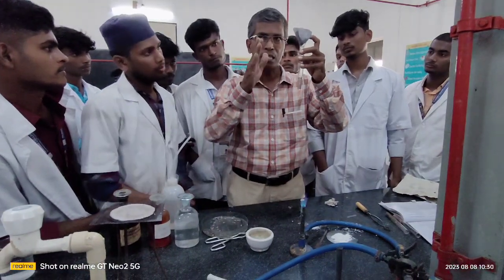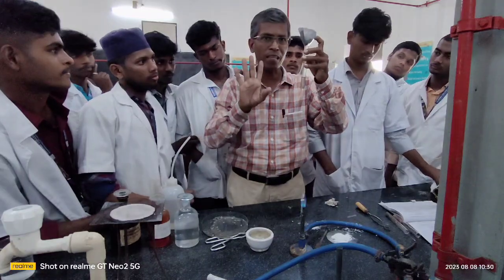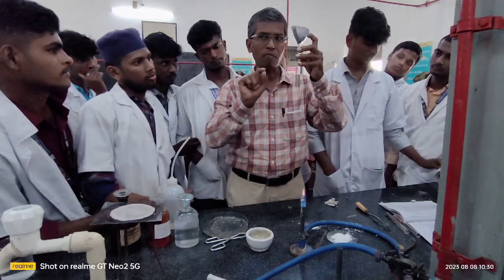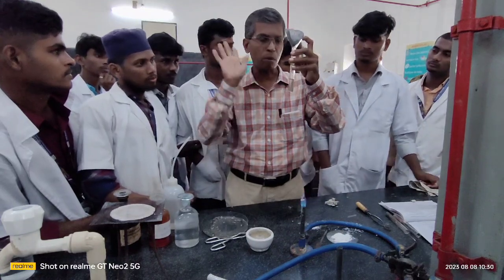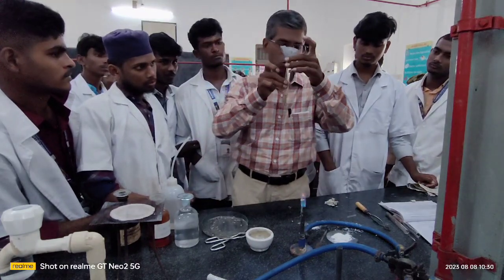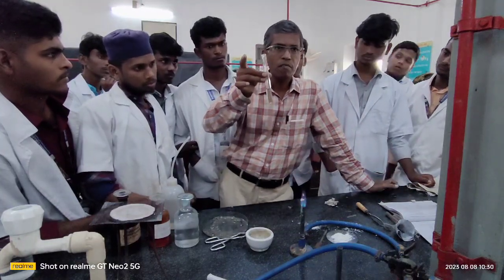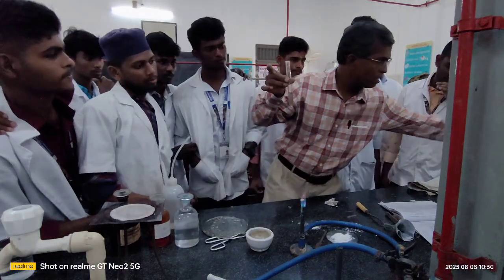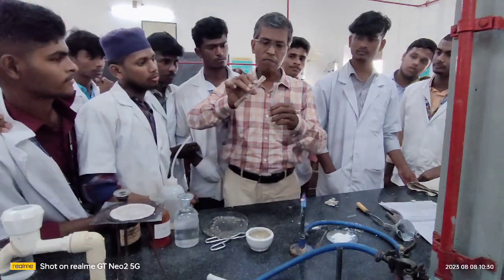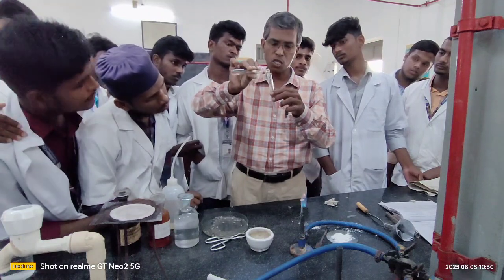I told you that the halogens and the sulfur part of the elements we are usually not providing. Therefore, your focus should be whether nitrogen is there in the organic compound or not. Now the filtration is over, and this extract is called sodium fusion extract. Very simple. Take a little amount of the sodium fusion extract in another fresh test tube.